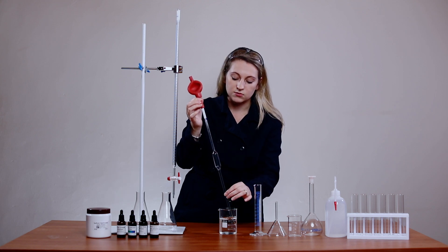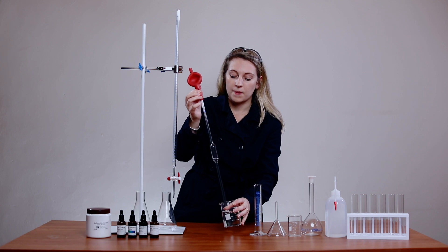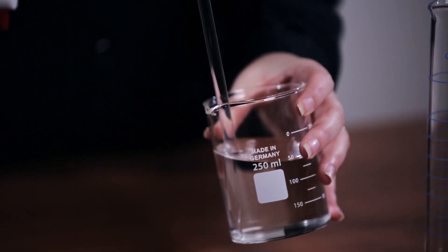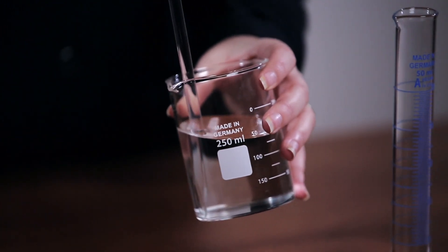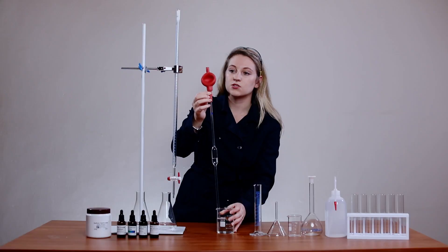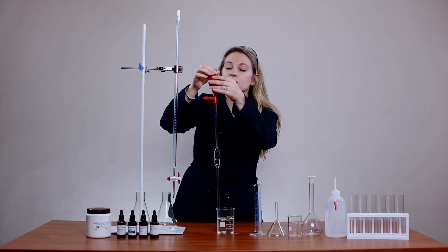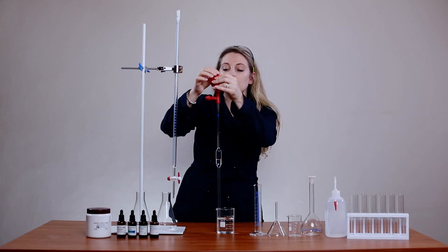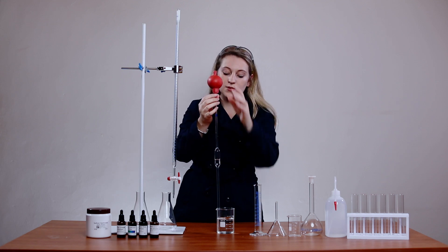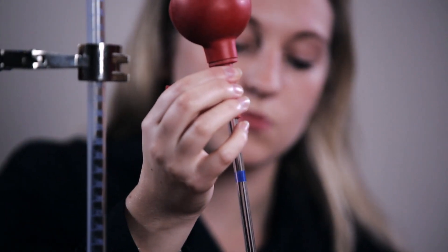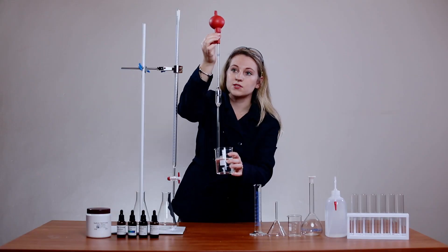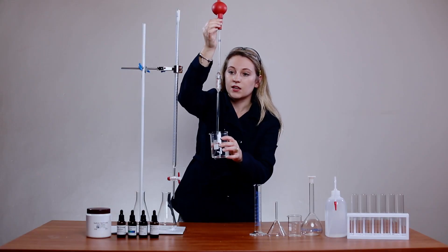It takes a while and sometimes if it takes too long you can just push this again and push it in to ensure that there's a vacuum created and then you can just press the suck button again and it will happen slowly but surely.